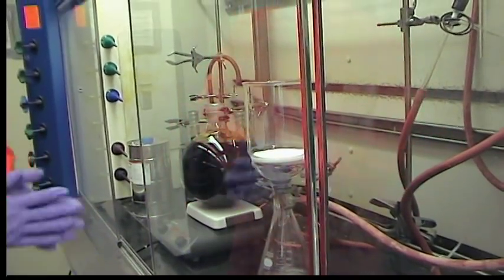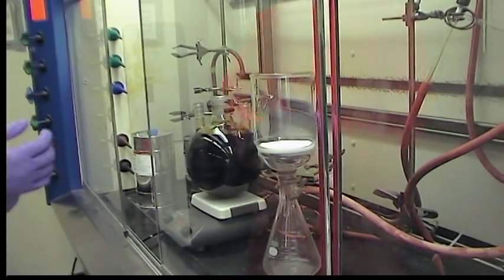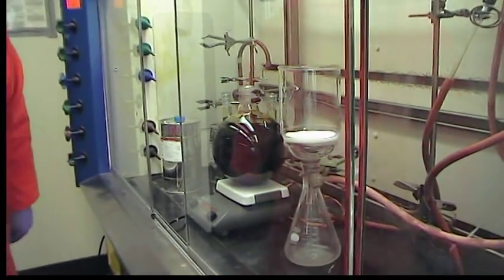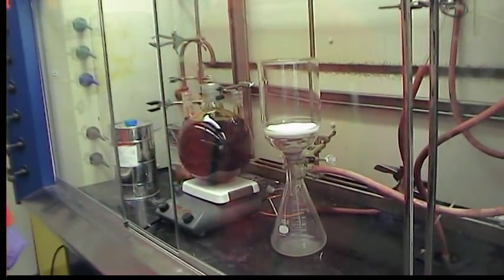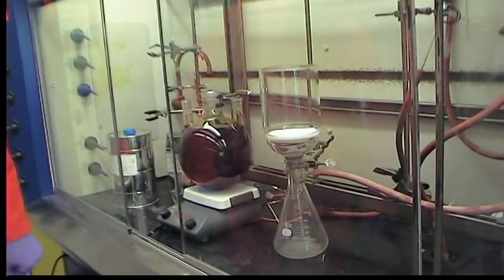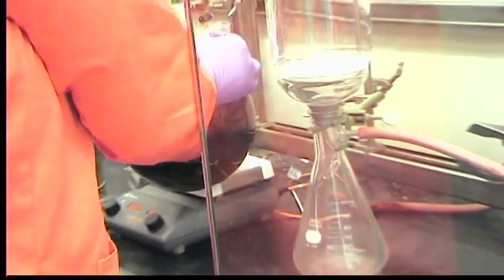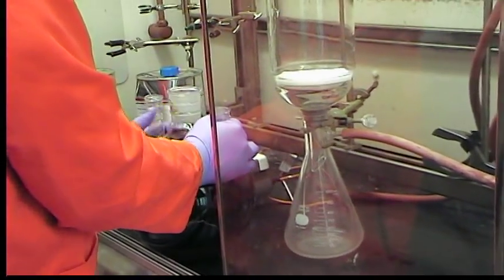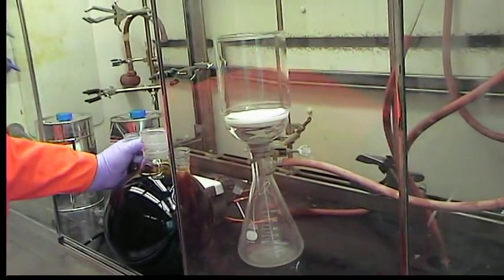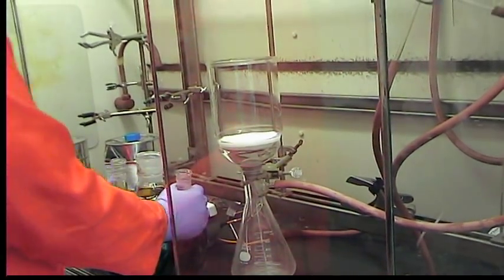Welcome back. The reaction mixture has been stirring overnight during which it cooled down. I turned up the stirring some time ago and you can see the liquid being dark brown and on the bottom the pyrylium salt has accumulated. We're going to collect that crystalline solid in this filtration funnel. This liquid is mostly acetic acid and acetic anhydride, so it's important to be careful.